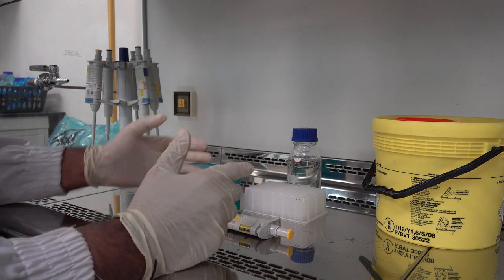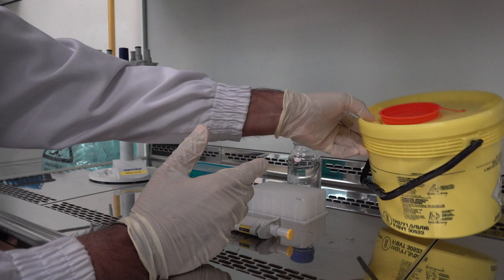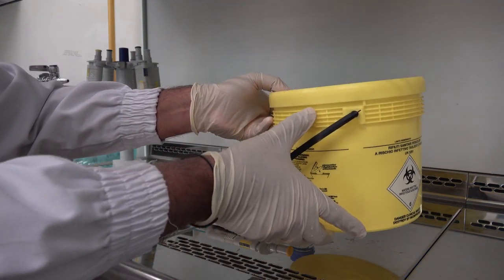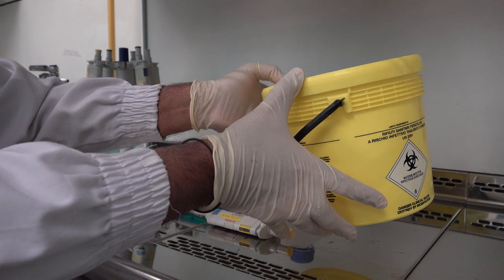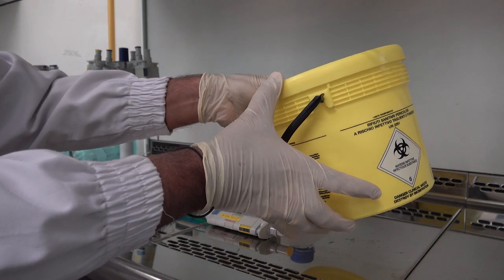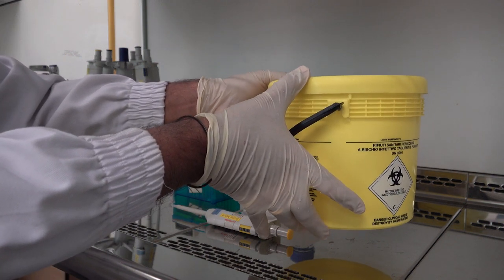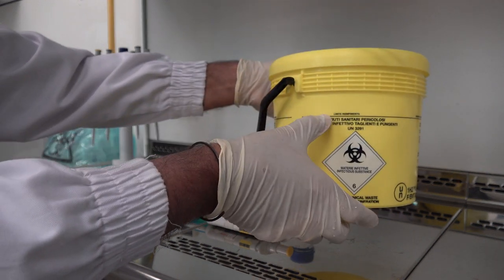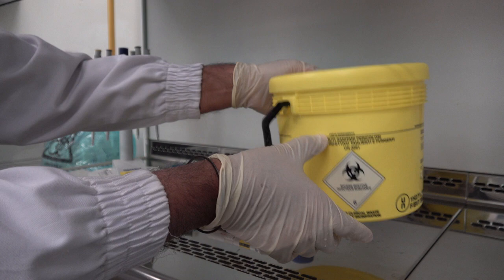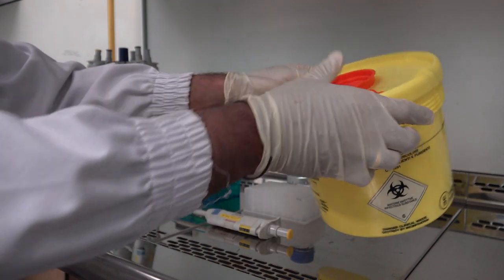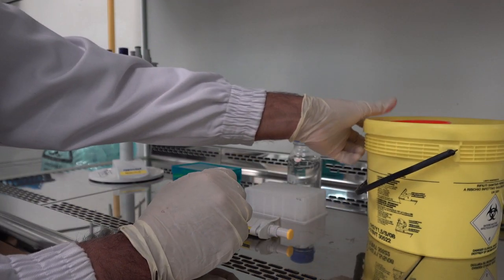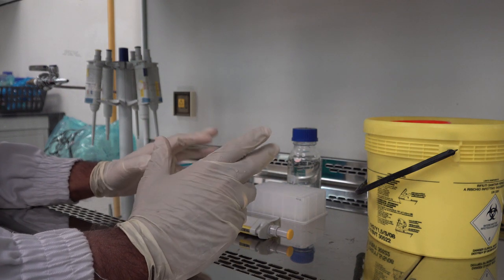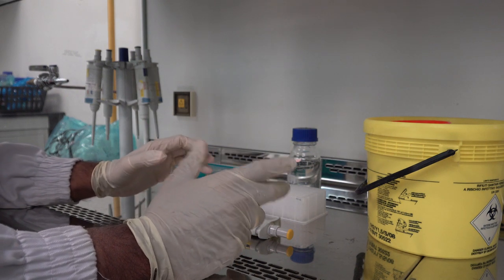With regard to clean up of this cabinet after use, please ensure that you dispose of this waste bin in a designated area and in accordance with the requisite standard operating procedure when it achieves a level which is two thirds full. This bin has to be sealed and disposed of according to the standard operating procedure which may involve autoclaving or incineration.